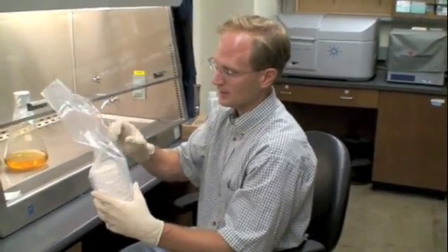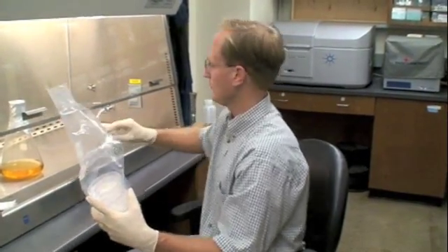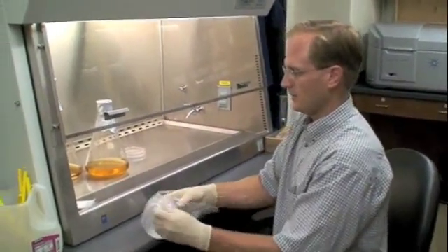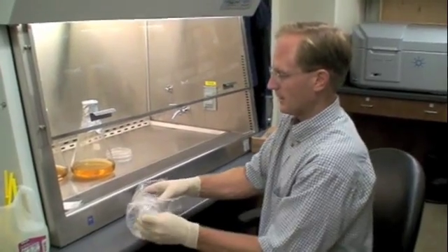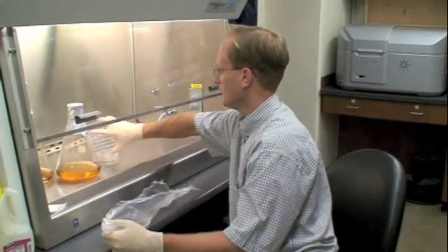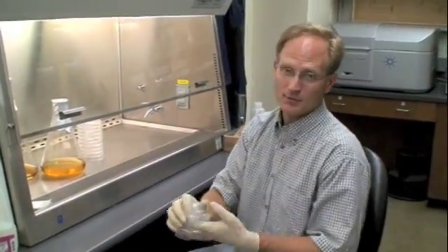Now the other thing about this, let's get these out. The plates are first upside down, and that's good. It's just the way that you normally handle them. The bacteria, when we incubate them, will put the plates upside down. And we'll also do all of our writing and annotation on the bottom.